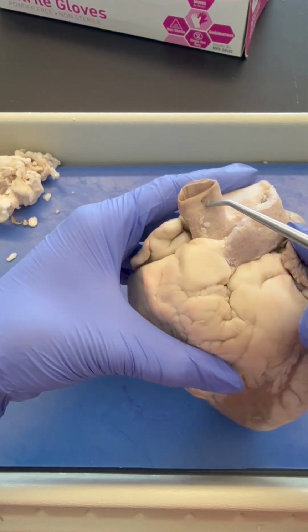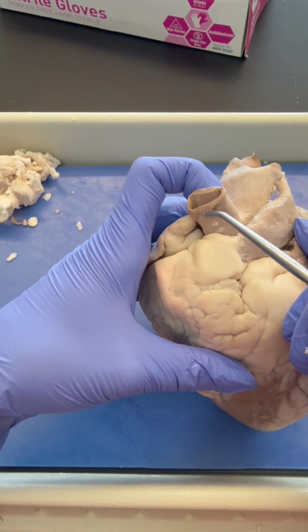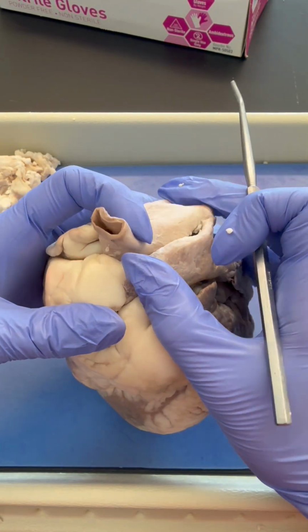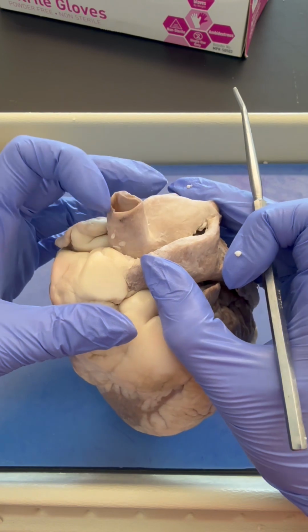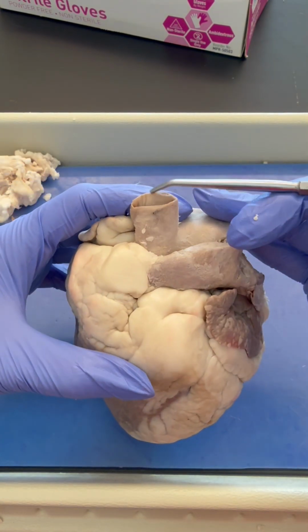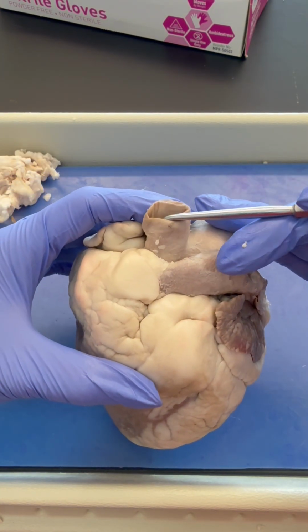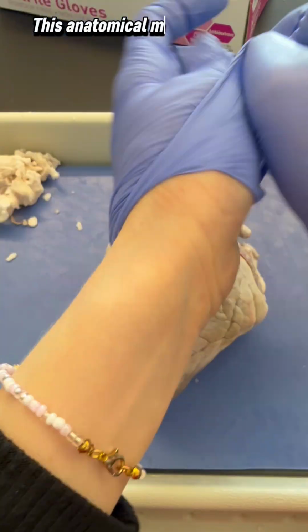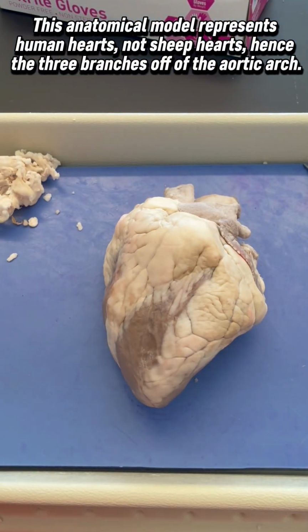But the ascending aorta here has the brachiocephalic trunk, and we have a brachiocephalic trunk. It's the first branch branching off of the aortic arch, but this is the only branch branching off of the aortic arch on a sheep heart. So we have three. I'm actually going to show it on a model I have.